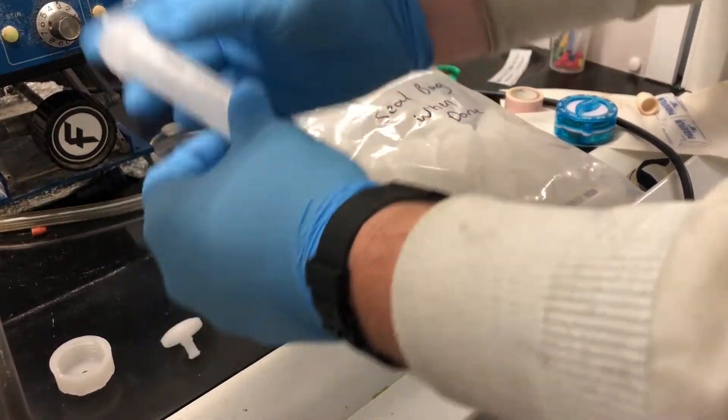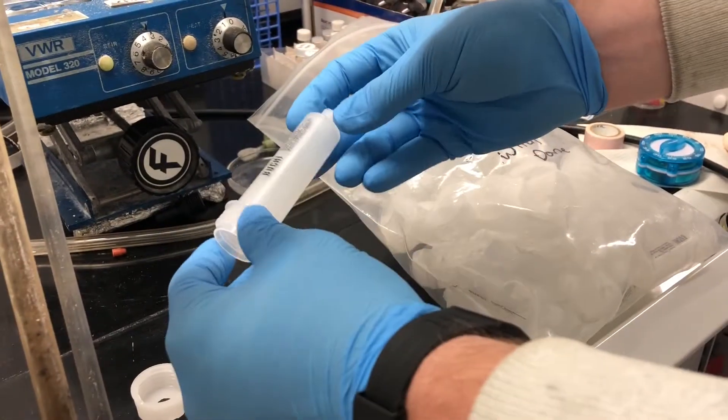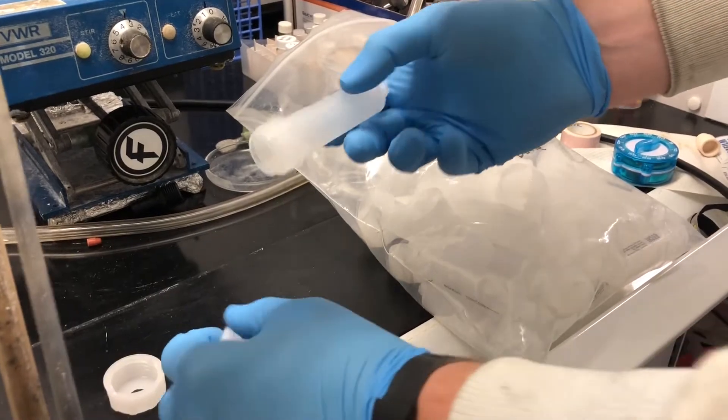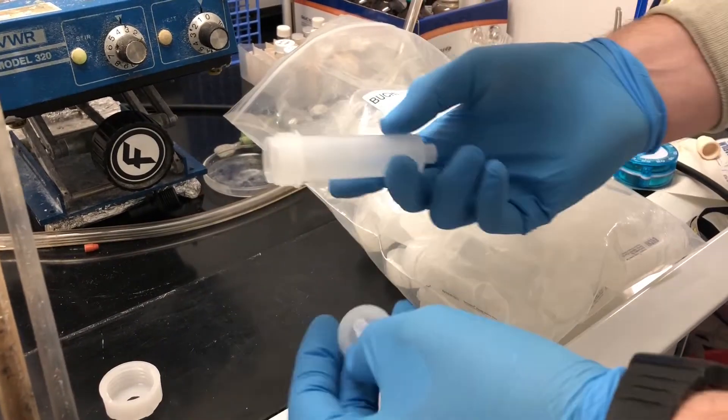I'm going to show you how to pack your own cartridge for a Buchi Reveleris or Biotage instrument.